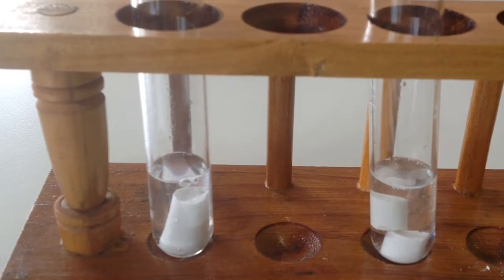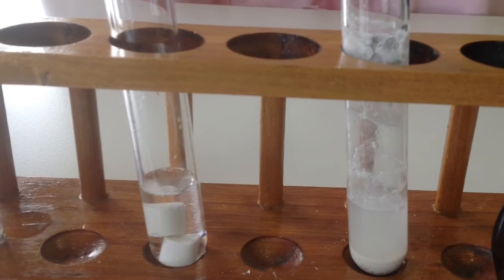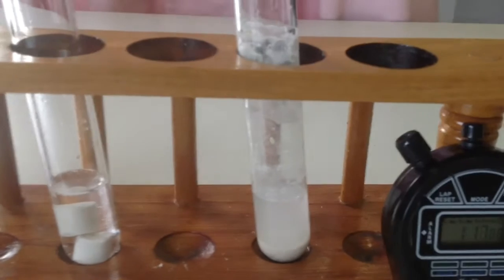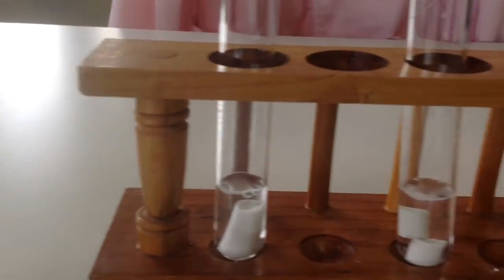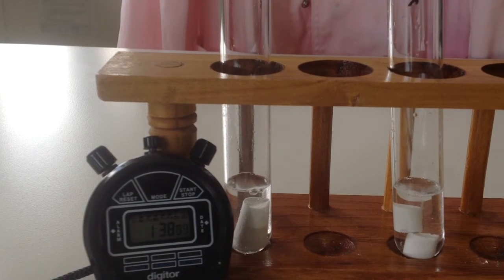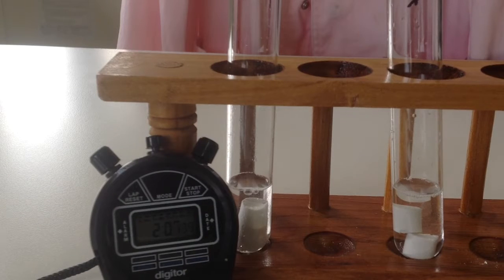Which one seems to be producing more bubbles out of those 2? This one's already reacted. And I put a mark for the height so that we can measure the height. So that one reacted really, really quickly. So hopefully you were looking at the stopwatch for that reaction. These 2 are still going. Oh, that first test tube looks like it's going pretty slow. Might be a good idea to take your observations from when I first added the chalk in.